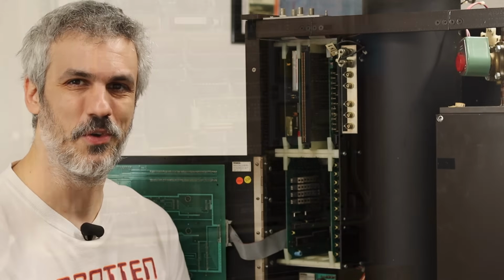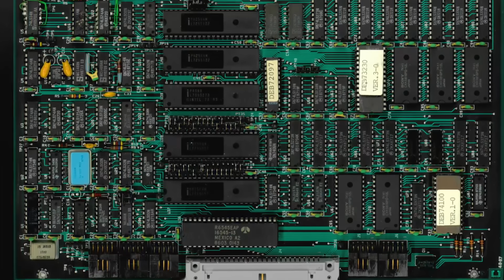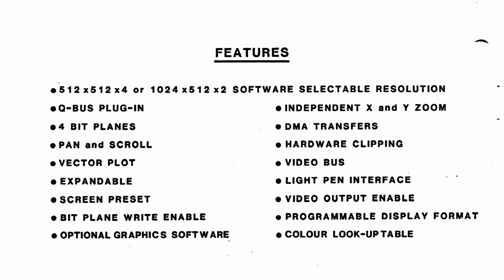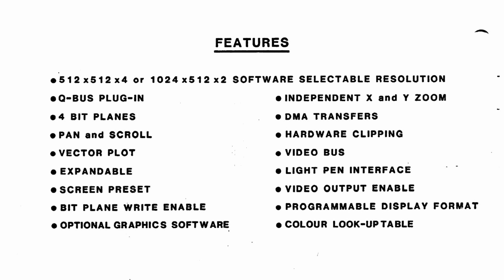The PDP-11 has a pretty bog standard 11/73 CPU in it, and that's it as far as standard cards go. Everything after that is either third party or completely custom. We have a QRAM 44B memory card with 2 megabytes of memory on it. We have a Sigma floppy disk controller for the 8-inch floppy drive. We have a Webster SRQ-D11 for the 5¼ MFM drive. Then we have a Matrox QRGB card that is paired with a Bomem-made DEB41. These two together allow us to put full color graphics as well as ASCII text on the same monitor.